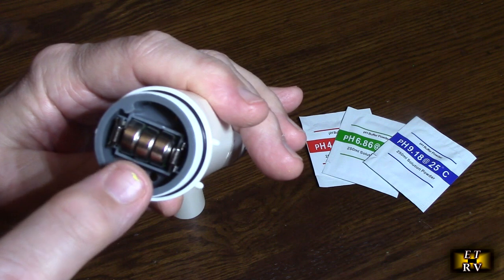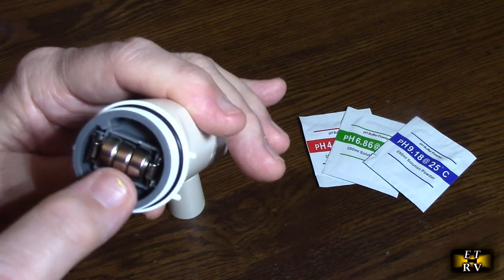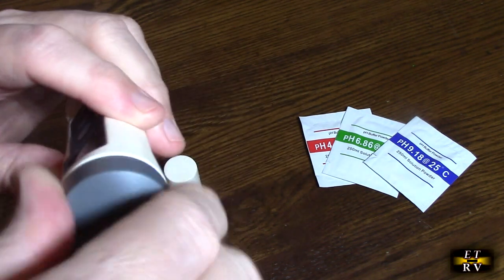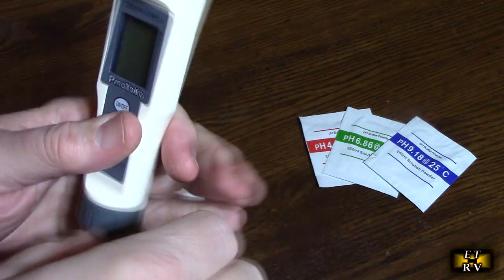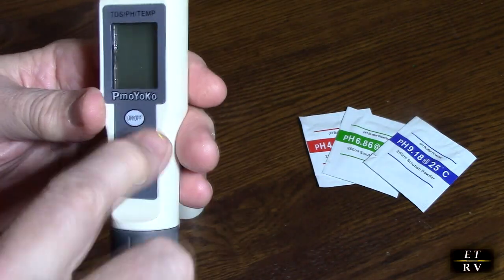When you're not using the unit for a long time, maybe a month or so, I would pull these batteries out and put it in a little baggie because whenever it's a digital product, they always use a small amount of energy to wait for you to push the button on.